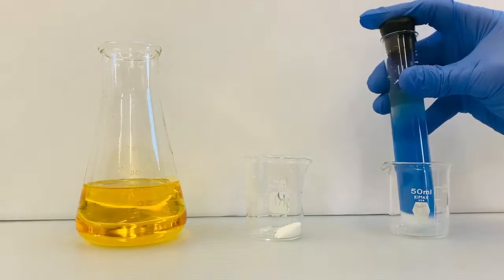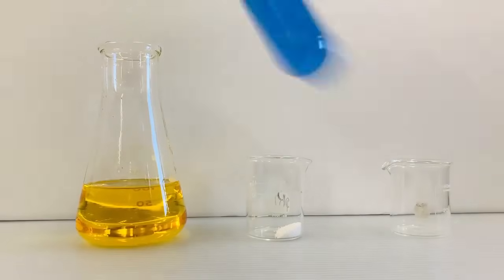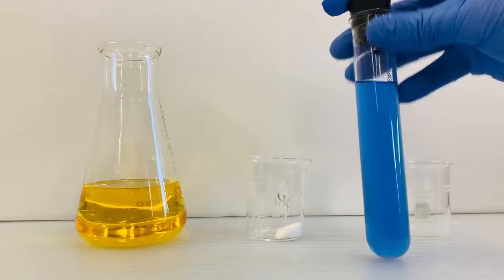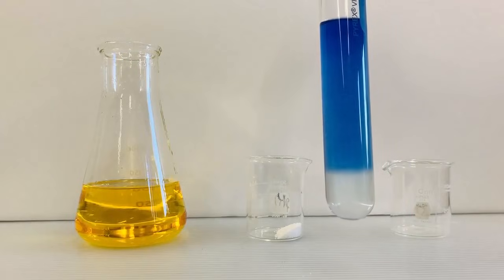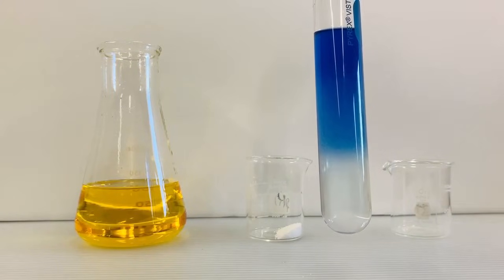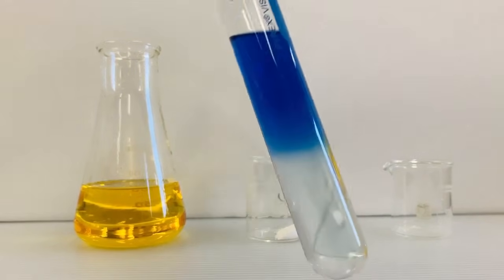Finally, let's cap off the test tube, shake it up, and see what happens. Well, that's cool. Now the fluid separates into two layers with a blue color on top and a colorless layer below.